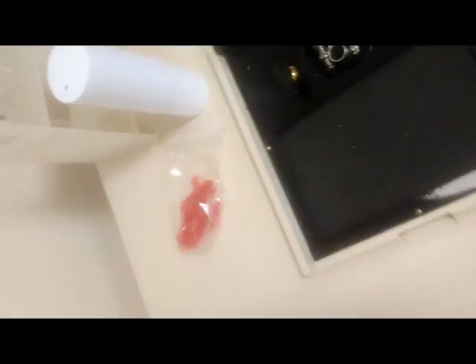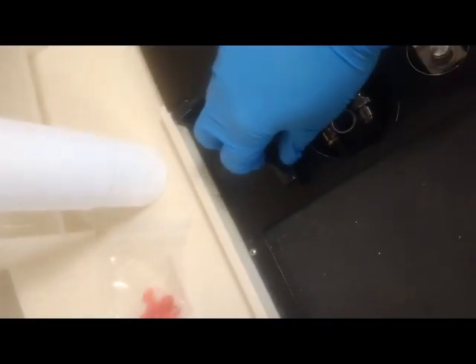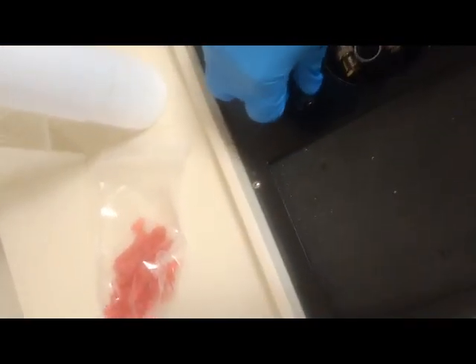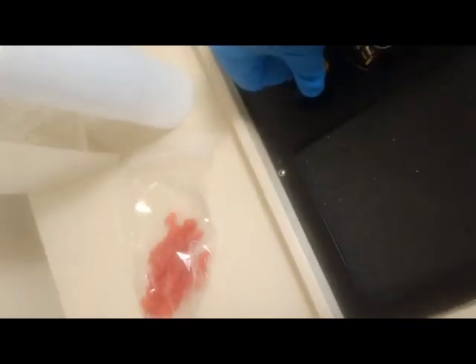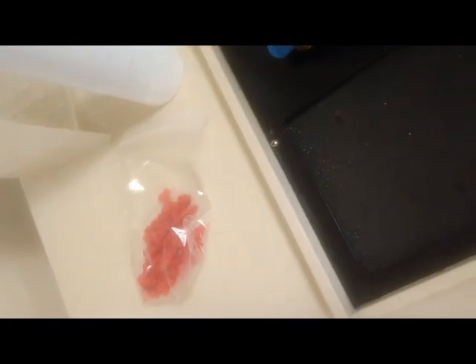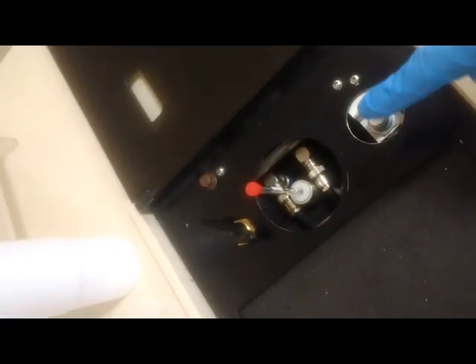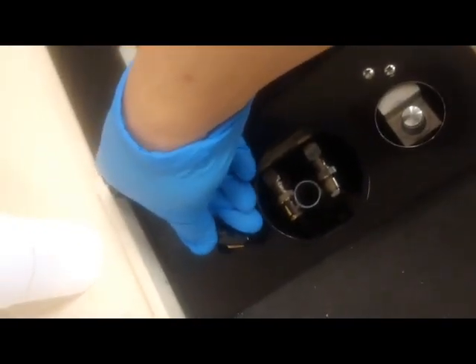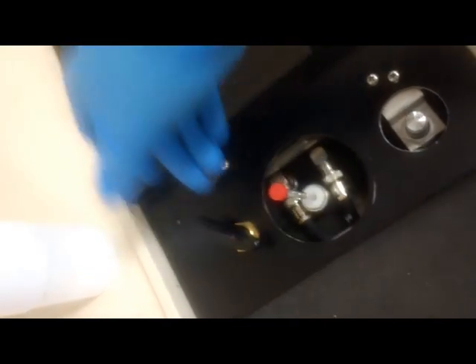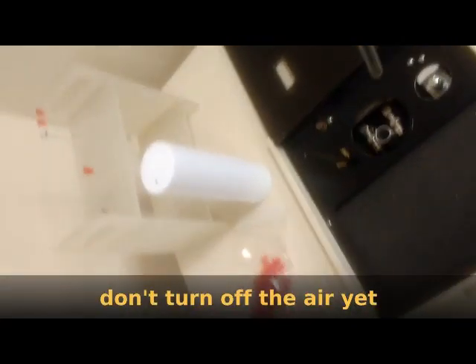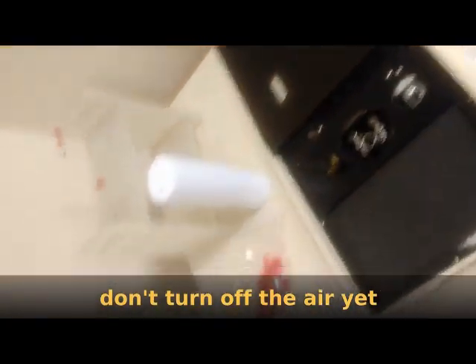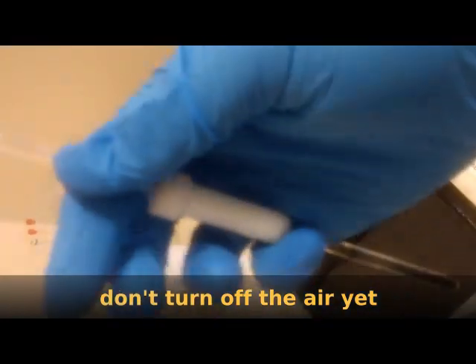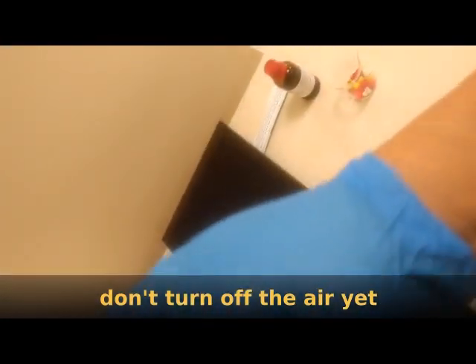Once you have your sample ready, you will of course want to head over to your NMR instrument. And on the top, it looks like this. If you open the top cover here, you'll see a valve. This is for the air compressor. What you want to do is to open this slowly. You don't want to open this very rapidly because if you do, the sample that you just saw coming up from the instrument, maybe I'll just show you that one more time. If you open this very slowly, you'll see the sample come up. You don't want this to come up too fast because if it does, it'll shoot up out of the instrument. And you want to take the sample out. You actually want to leave the air hissing like that while you're switching the sample holder from the tube that's already in to your tube.